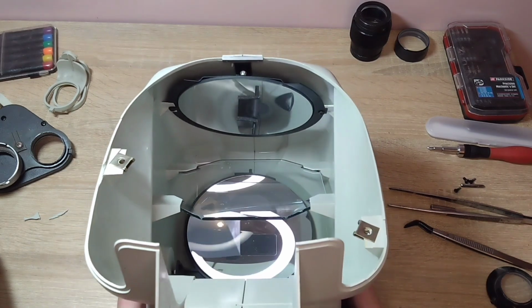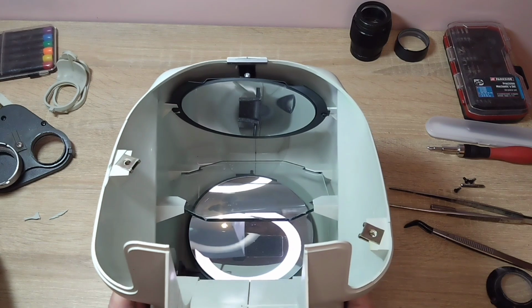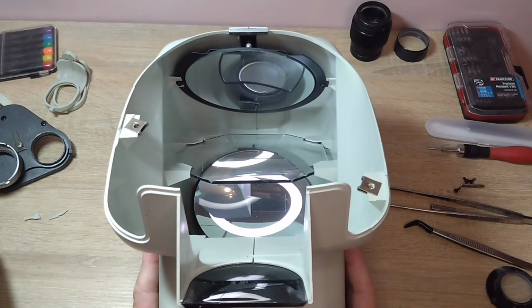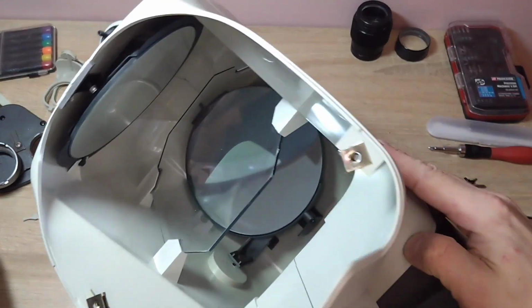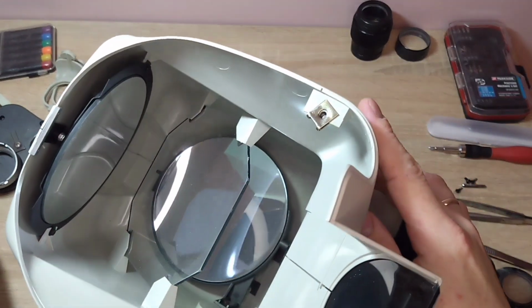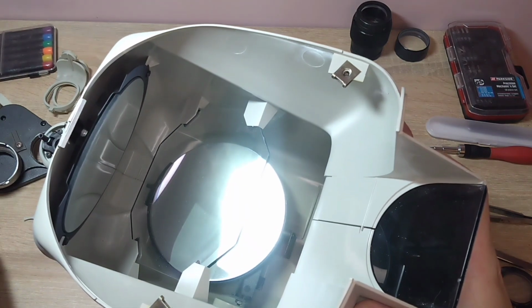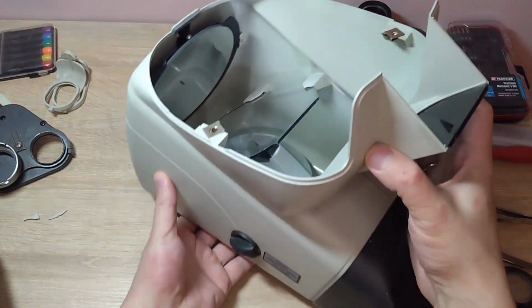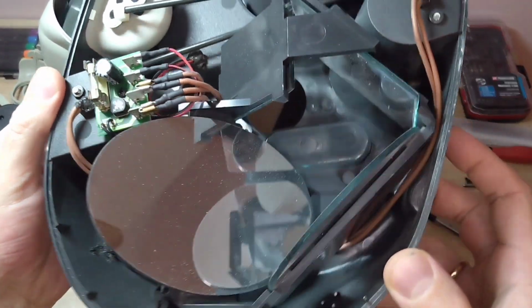First of all, before telling more, although there is very little information on the internet about this optical scheme and how it all works, I want to blow it out. First, I won't wipe it, because it's quite difficult. I just want to blow it out. I'll take the gun from the compressor, and I just think that will be enough. Here too, on the mirrors, look how much dust there is.